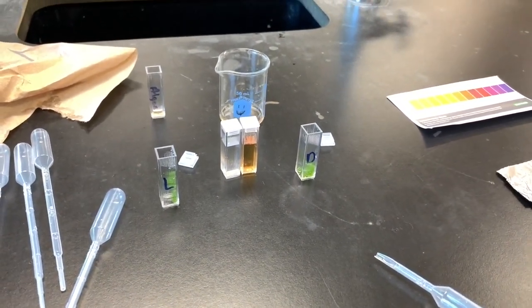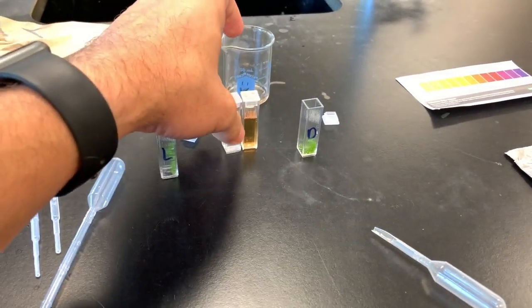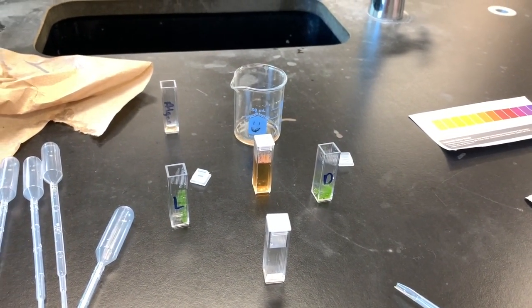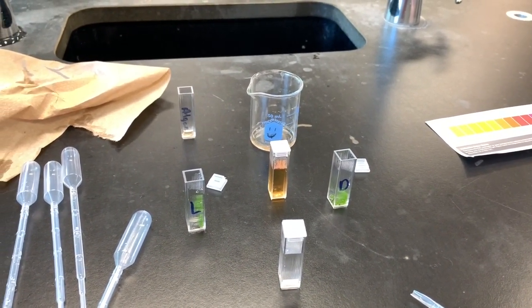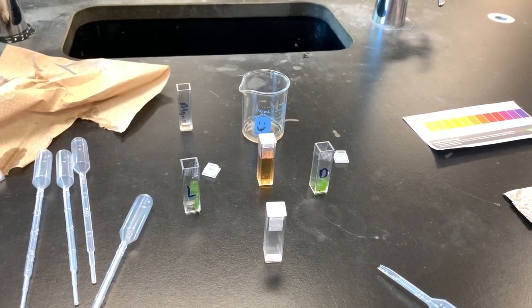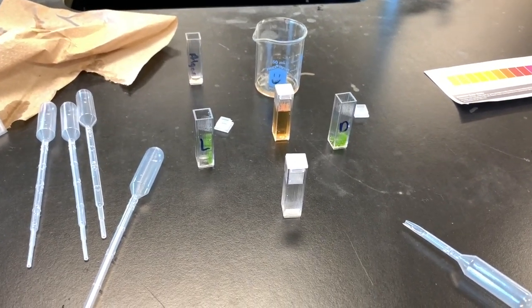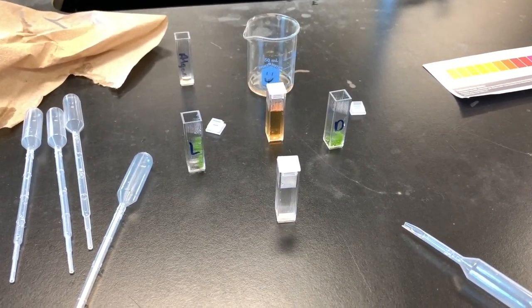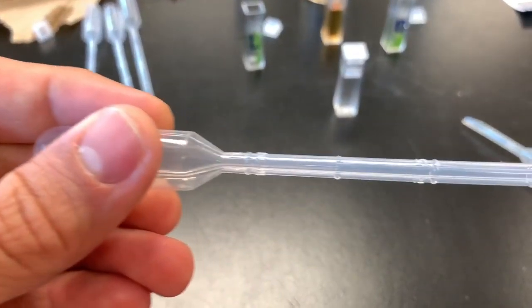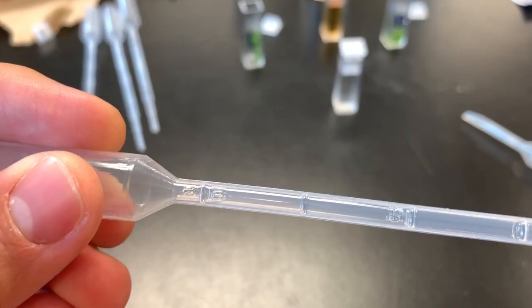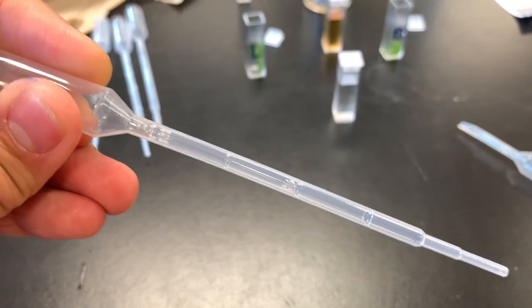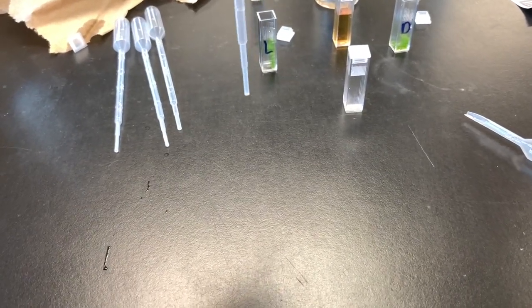So once you do that, now you're going to take the distilled water that you have here, and you're going to add one milliliter of distilled water to each of the cuvettes. And you're going to let them sit in the water for five minutes to allow them to sort of wash out. Now how do you do one milliliter? Well on your pipette, the very top line up here, you can see is one milliliter. So you just pull in until the liquid gets up to one milliliter, and then squirt it in.